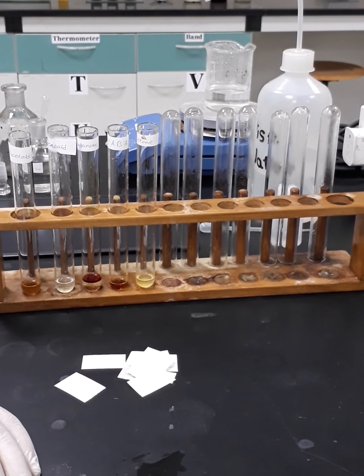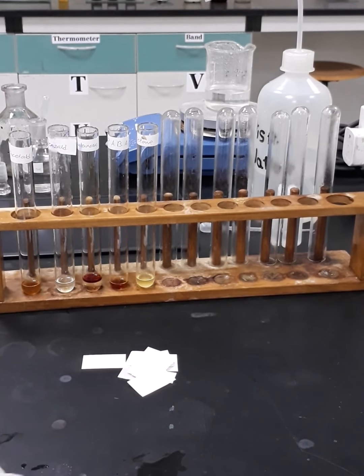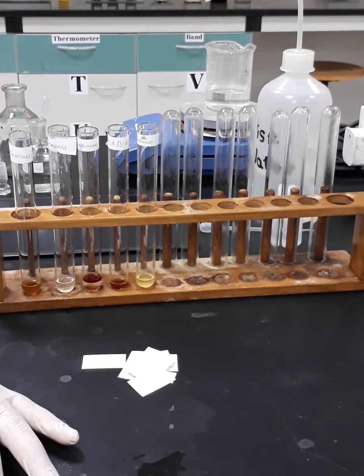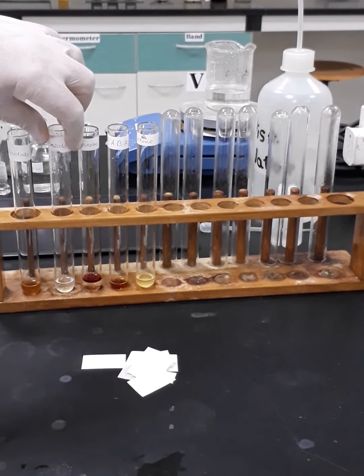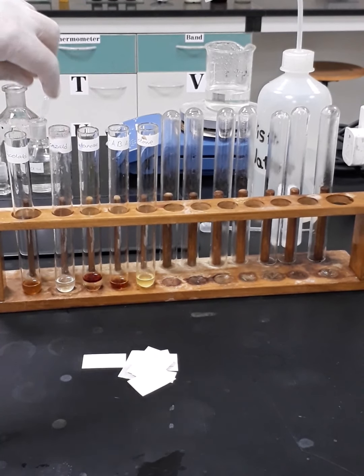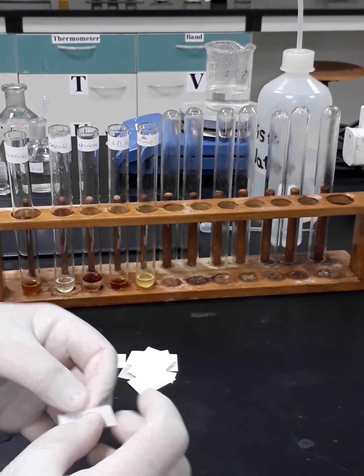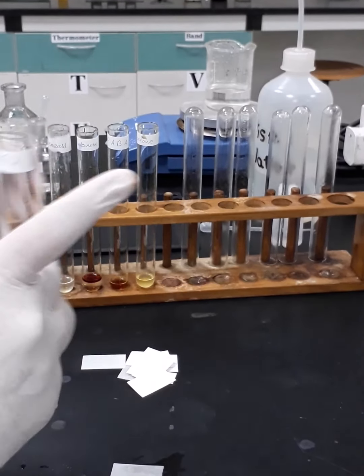Acetaldehyde, then benzaldehyde, then butanone, then acetone. Of course, whatever you are seeing in front of you, this is the result of the first test, which is the iodoform test. Okay, so this one is para-aminobenzoic acid, which is this one. Just label it.